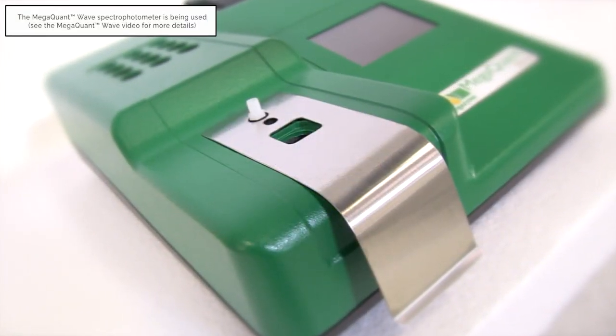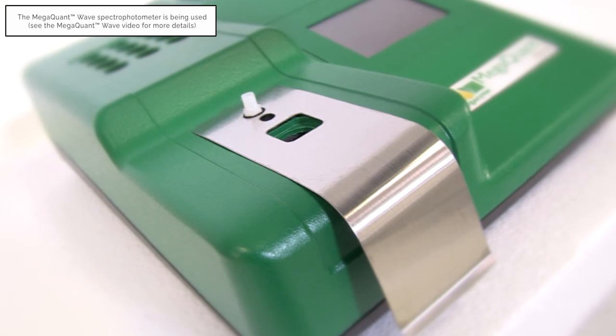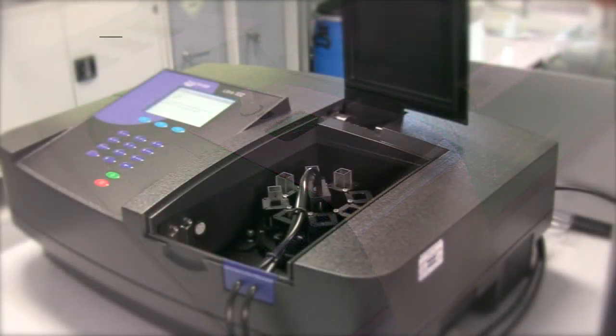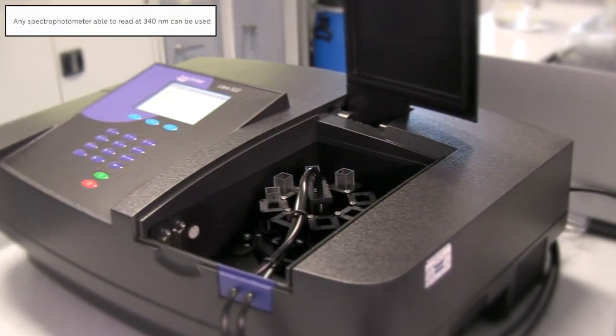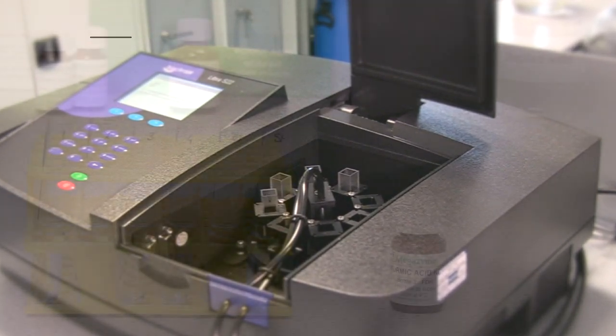Read at 340 nm. Alternatively, a recording spectrophotometer with 1 cm path length cuvettes can be used.